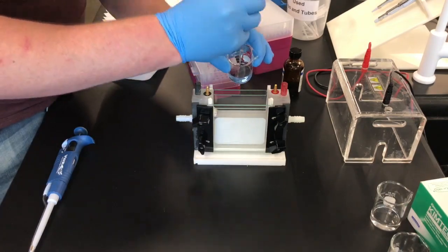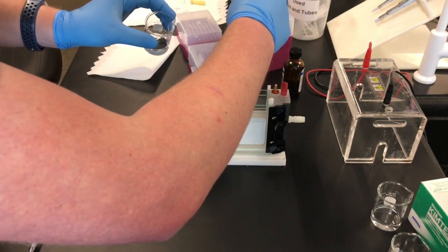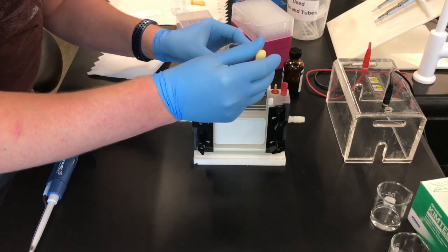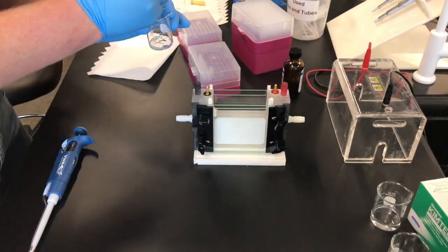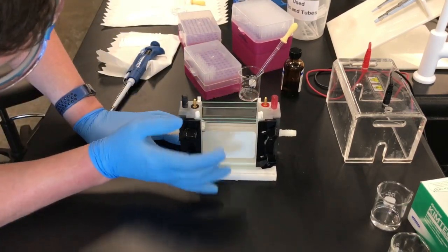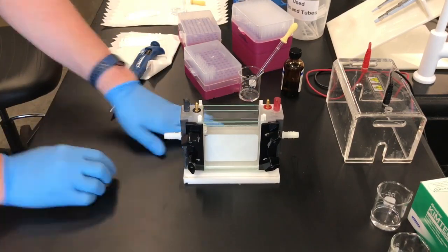Quickly get a pipette and pipette it in between the glass plates. You are going to fill up the resolving gel up to the lower line that you drew originally. If there are any bubbles, you can shake it and tap it to try to get the bubbles dislodged.